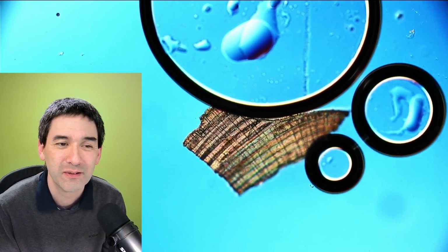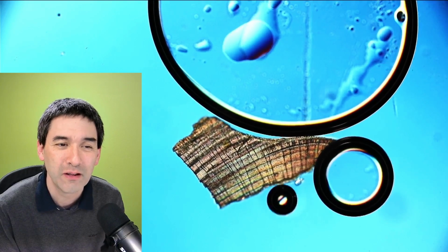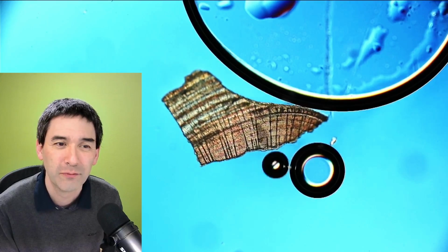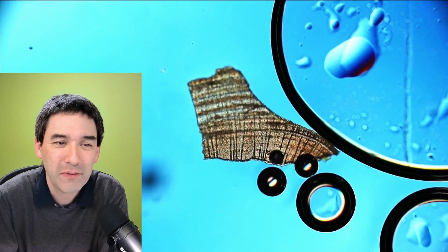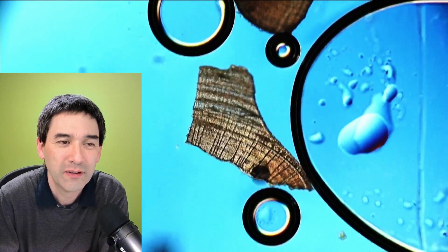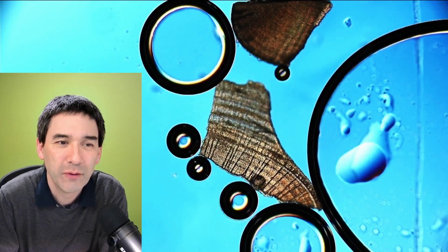And then it starts to appear in some parts of the seashell where it's able to react best. Oh, look, here we go. Okay, you get the idea, right? So it's really reacting and showing that this is indeed a fragment of a clam.